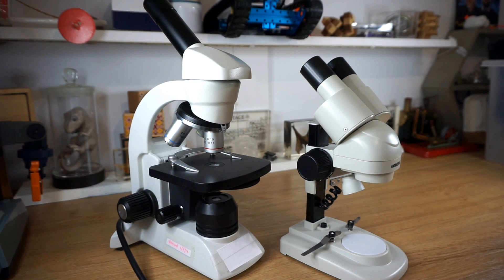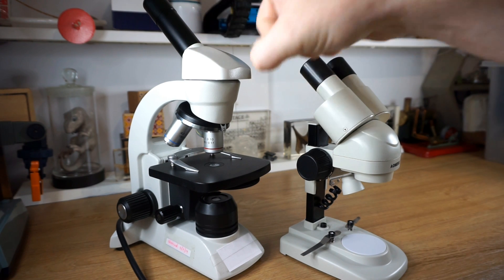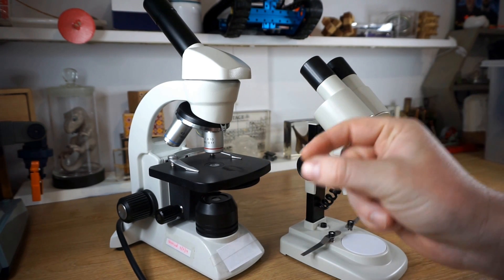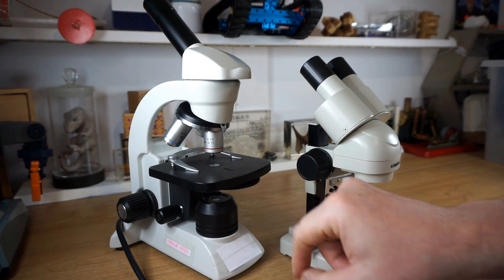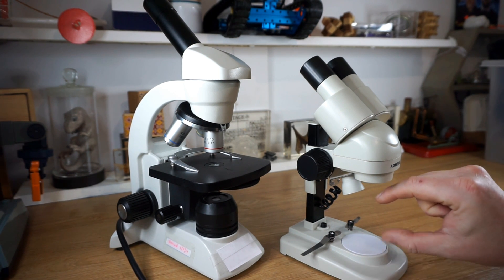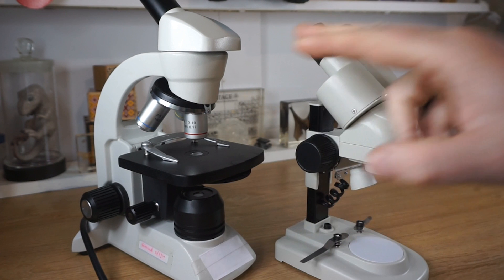So that's a brief overview of the main differences between our two main microscopes. The compound microscope, or monocular microscope, has one eyepiece, multiple objective lenses you can switch between, a lamp or mirror that shines light up through the stage and specimen, and the specimen must be really thin or really small. It also has both a coarse focus and a fine focus knob. With our stereo microscope — a binocular microscope with two eyepieces — you can fit much larger specimens due to the larger gap between the stage and objective lens. Now let's look at some examples of the sorts of specimens you might look at with each microscope.